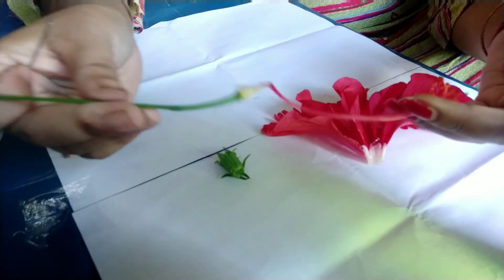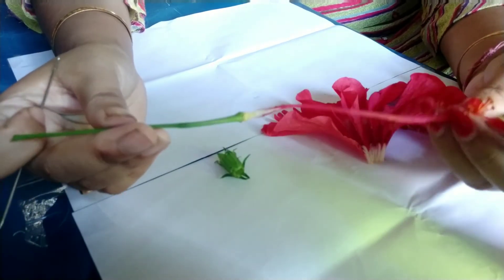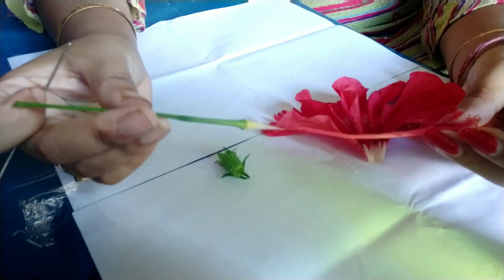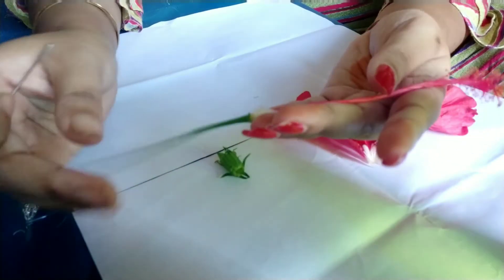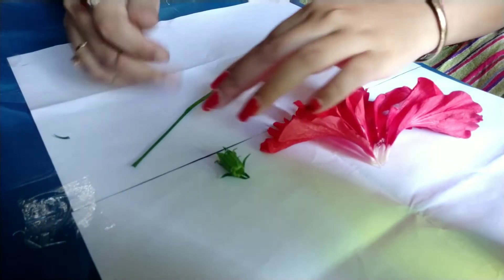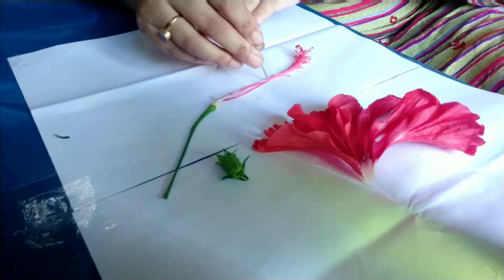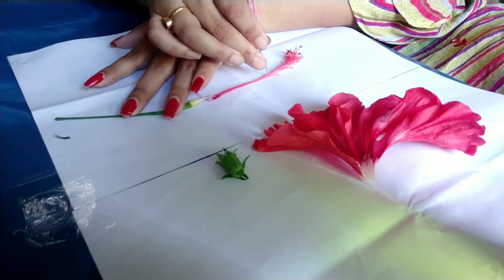Now I am getting the inside part of the hibiscus. In hibiscus, the male reproductive part and the female reproductive part are together. The male reproductive part is called the stamen and the female reproductive part is called the pistil. The stamen is here and the pistil is here. I am going to cut it into two parts — I have made a cut this way with a needle using slight pressure.